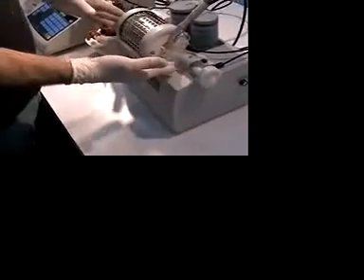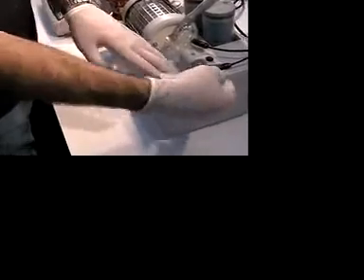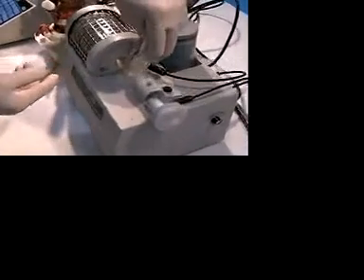Now, in this particular setup, we are going to introduce a sample by removing this cap and moving in the sample from the end. You notice it does have a stopper here but we do not use that for our purposes.